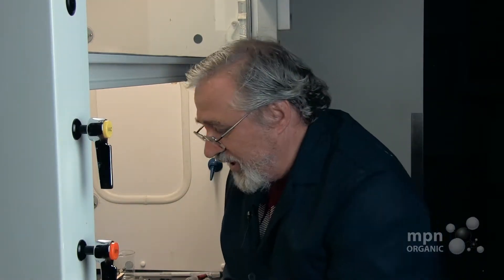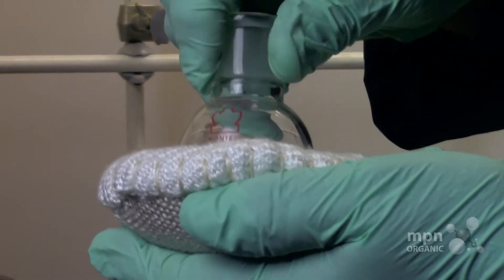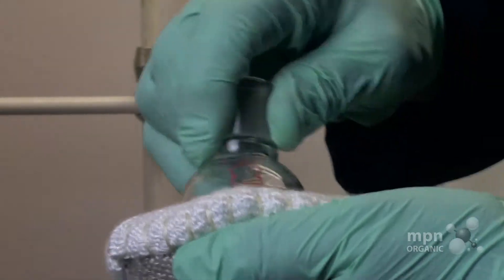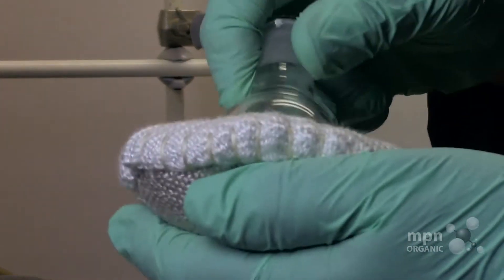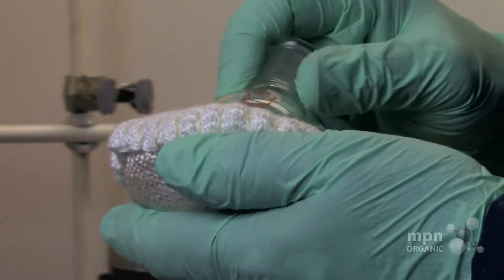This doesn't have to be on right yet. We're going to use a 50-milliliter round bottom flask, which you have in your supply — you can see it says 50 mils right there. This should fit right into the heating mantle very comfortably, almost like a baseball in a catcher's mitt. Here I have a 25-milliliter flask — it also seems to fit, but it's not designed for it. The 50 is designed for this, so don't use any round bottom flask that doesn't fit your heating mantle.